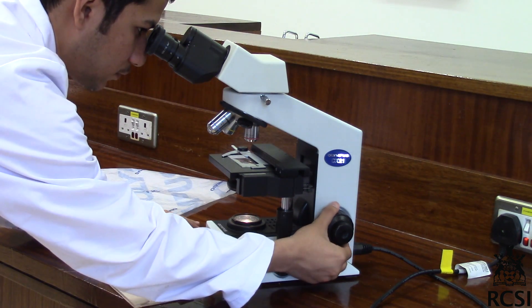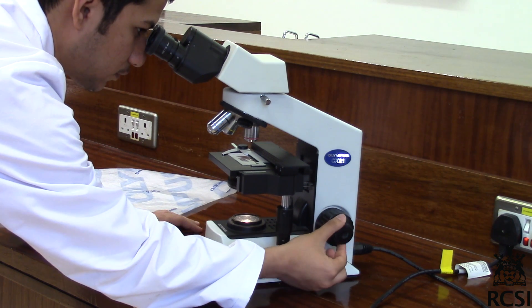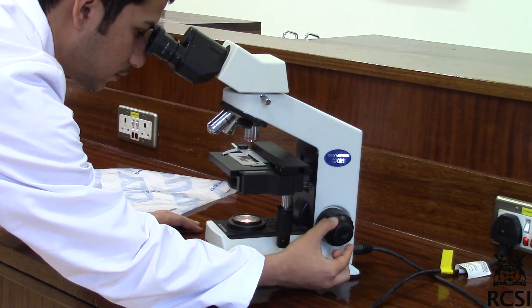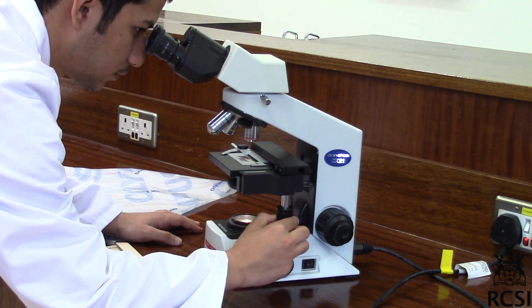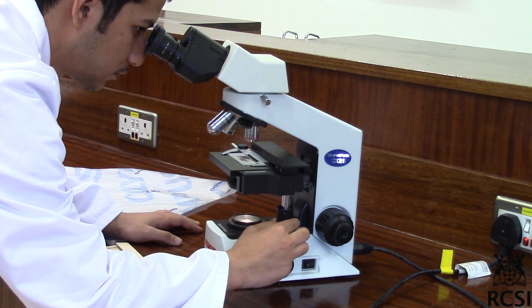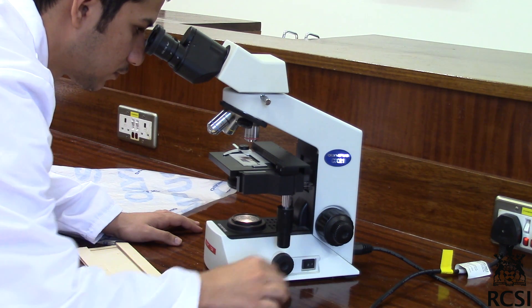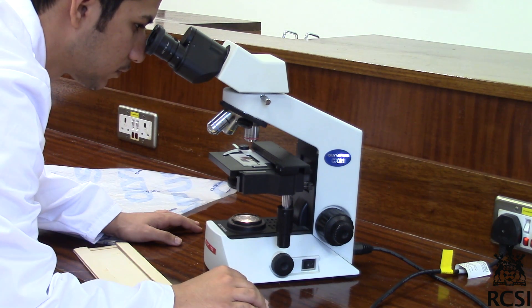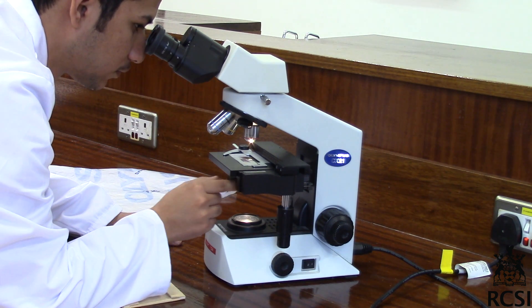Use the coarse adjustment knob first, then use the fine adjustment knob until you see a clear picture. Use the Y-axis and X-axis knobs to position the slide. Use the iris diaphragm to increase or decrease the illumination.